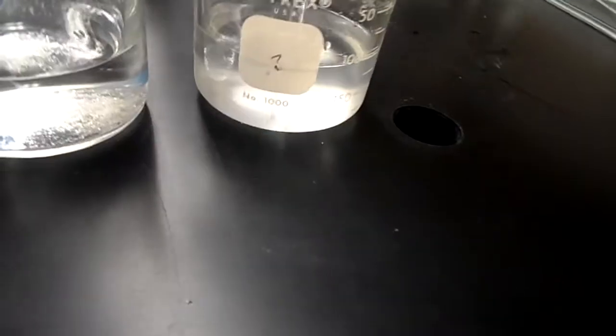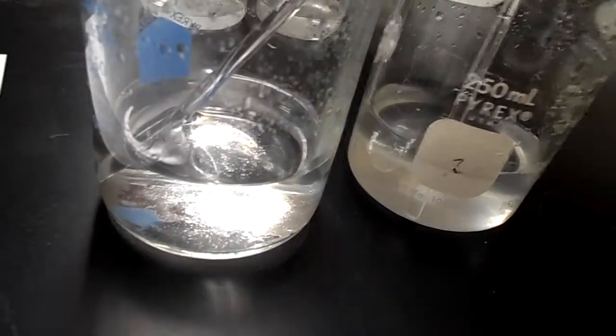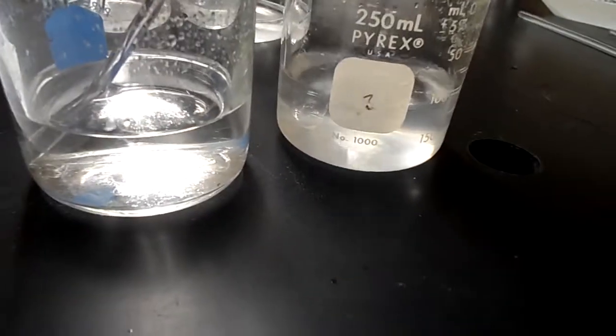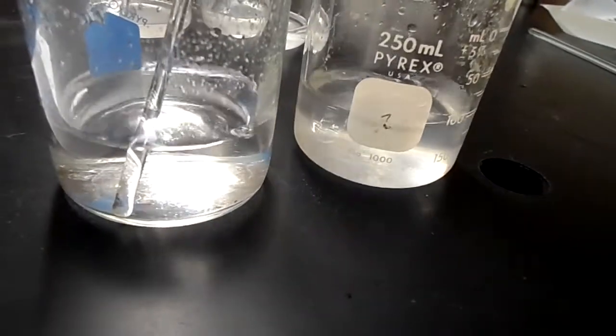Same thing. Let's go back to our tap water here and see how they look. Okay, and then I'll also stir up my alcohol. Okay, so we're going to let the alcohol sit, but our water right now is actually almost done. Yeah, it's looking really good here. Okay, so I'm going to hold these up so you can see it.